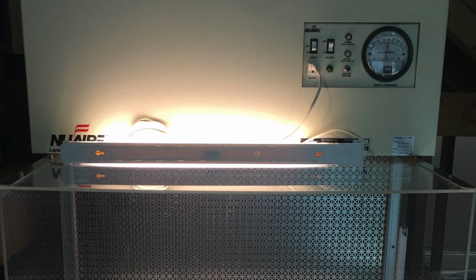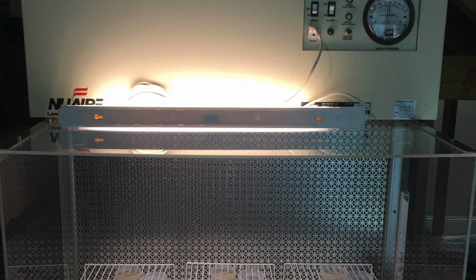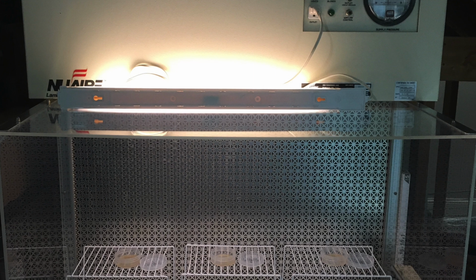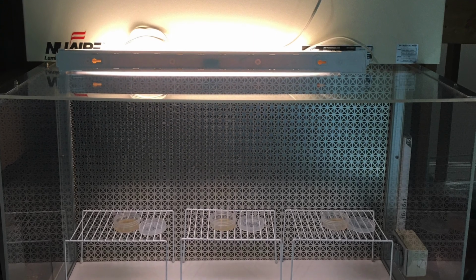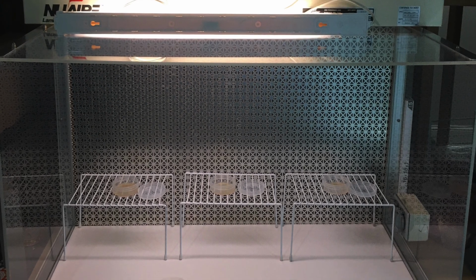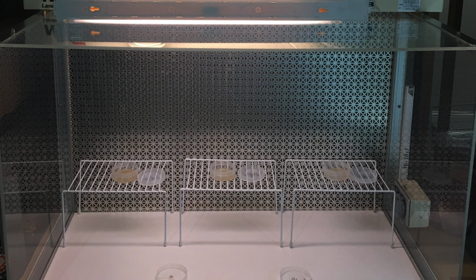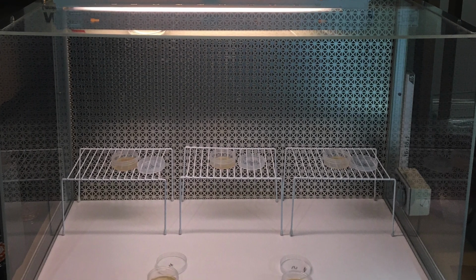It was a used one, and I had cleaned out the inside and then sprayed Lysol into the blower on startup and let it run for a while in order to remove the musty smell. It tested out okay, had no contaminations, and had worked well for previous grows before things started going bad.